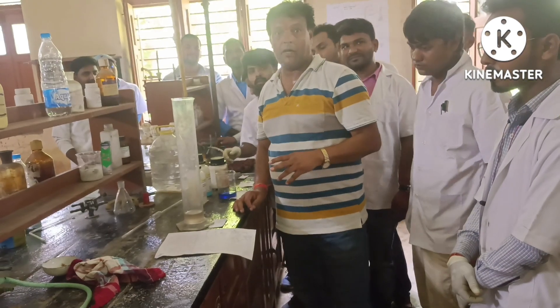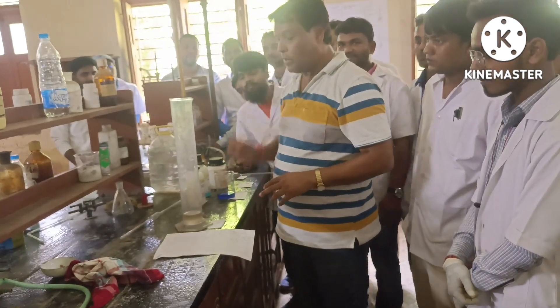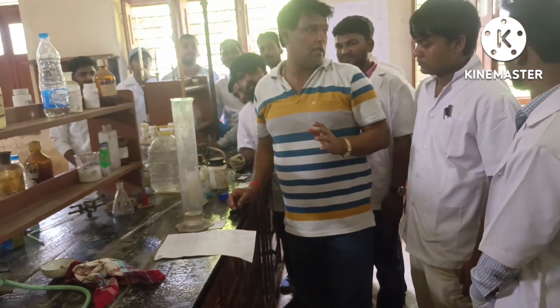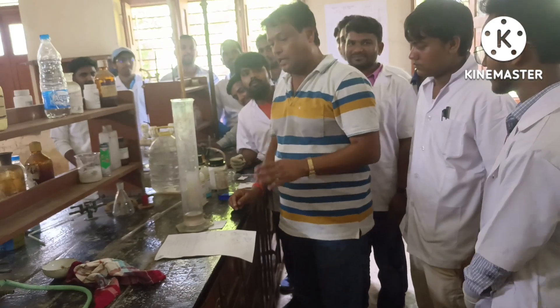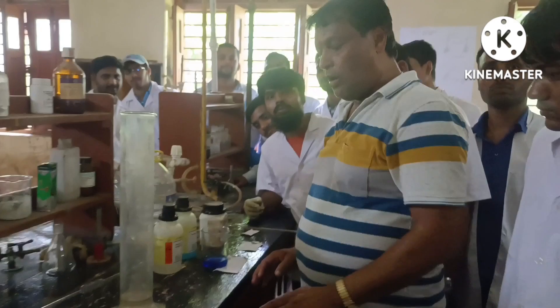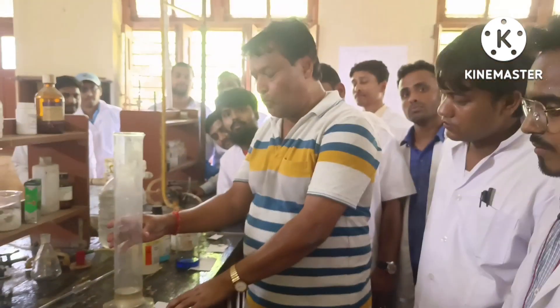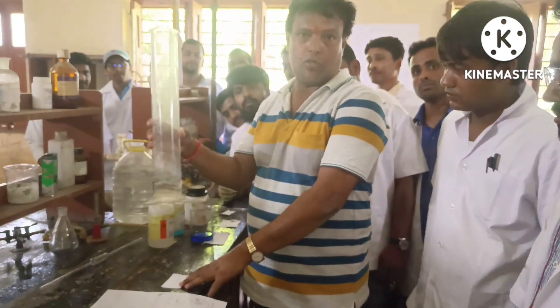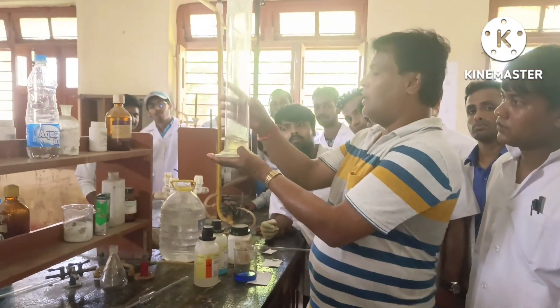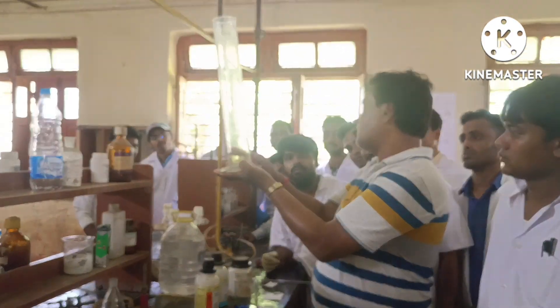For PG Semester 1, we will discuss one very important practical — the estimation of glucose. For estimation of glucose, first of all, we have to prepare 2% glucose. Here in this jar, we have just prepared 2% glucose.